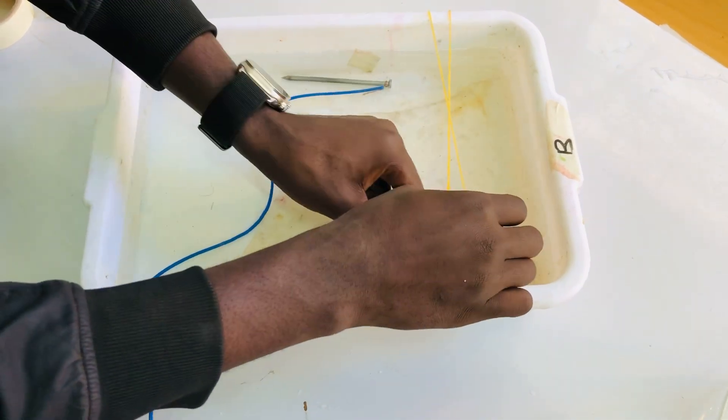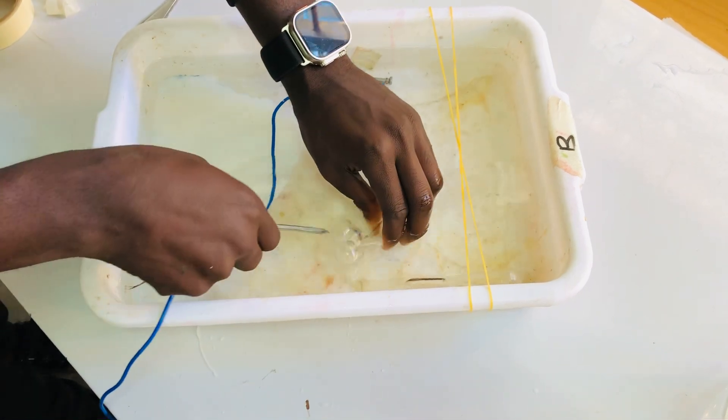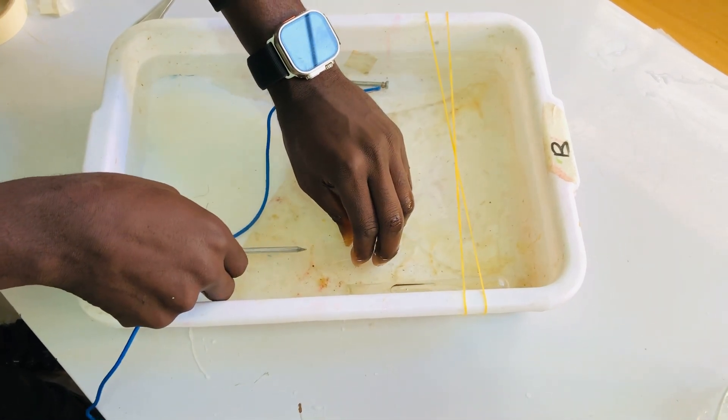Let's put some salt in the water. I have to fill water in this test tube.